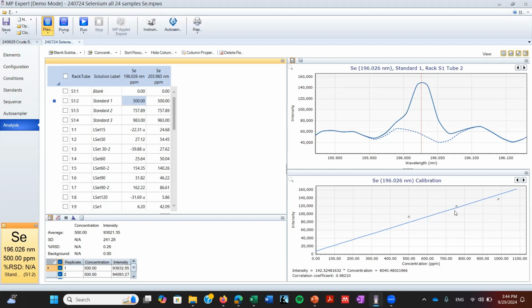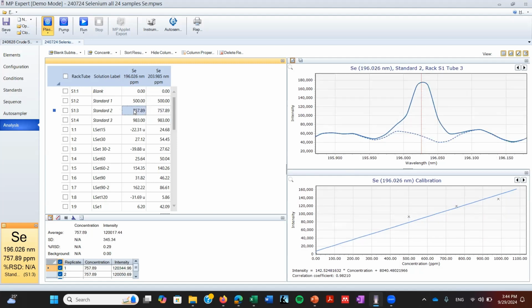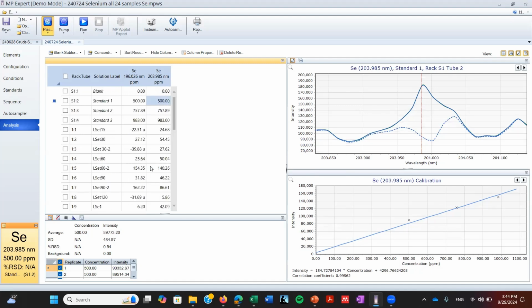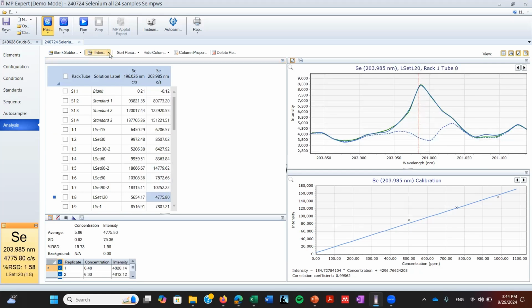In this case, and in most of the cases, I try to work with three different standards. In this case, we're working with 500 ppm, 750 ppm, and almost 1000 ppm. And we're working with two different wavelengths because we are developing a method. So we want to see which one is more accurate. So once we have this, we want to see which of these data are valid. And the way to do that, we have to go here, that I think the default is concentration. So we have to click here. We're going to have intensity. We are going to click there again, and we're going to have the unadjusted concentration. And that's what we care about right now to see if the data is going to be valid or not.